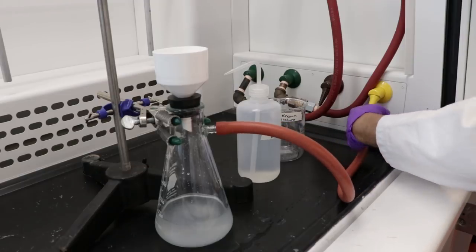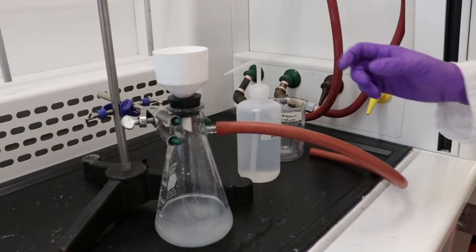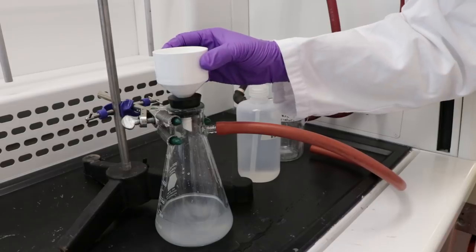Disconnect the orange tubing from the yellow tap. Then remove the top of the funnel.